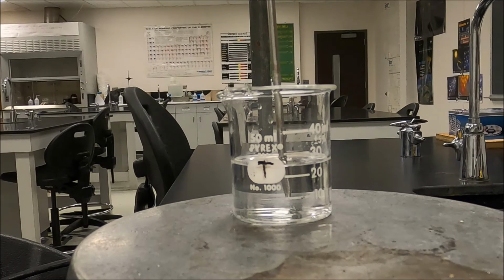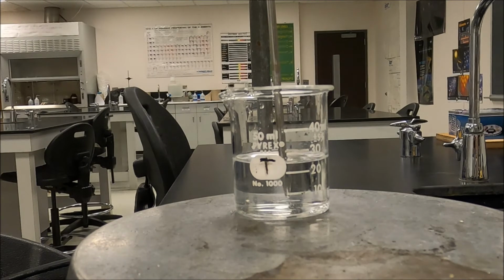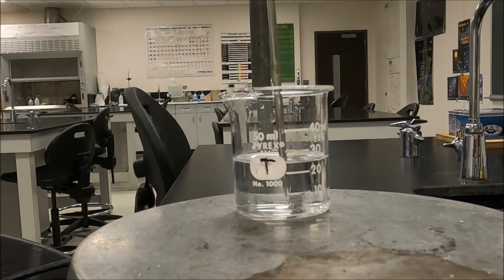It's big fat bubbles that rise up from the middle and burst at the surface. Okay? Remember that boiling is a non-equilibrium situation, because when that bubble reaches the surface, the gas that was in equilibrium with the liquid phase escapes into the room. So it's non-equilibrium.